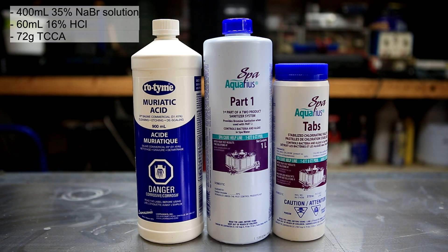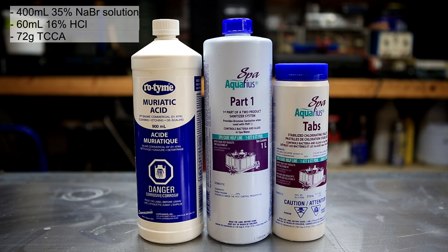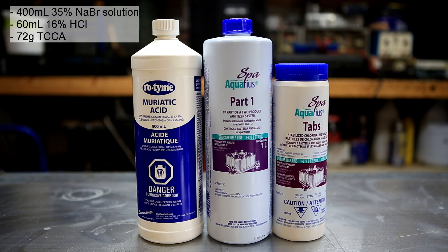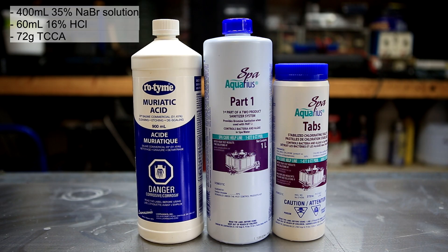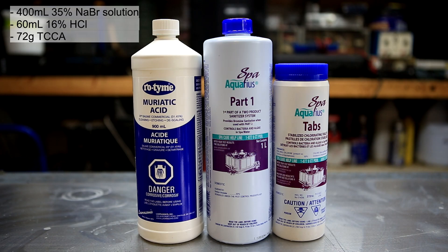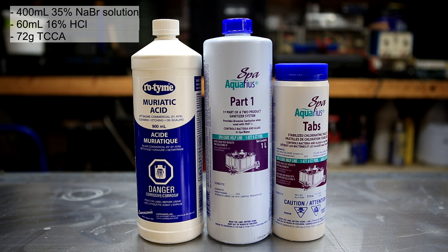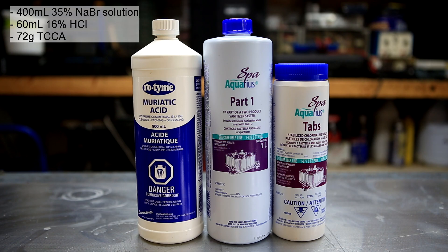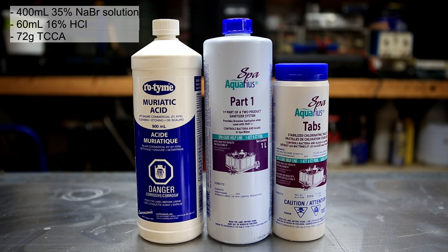In Canada, only the sodium bromide solution is sold and it's very hard to get the powdered form. The TCCA and hydrochloric acid will be used to produce chlorine gas, and the sodium bromide salt is our source of bromine. In short, the chlorine will displace the bromide ion to produce sodium chloride and bromine. Interestingly, the amount of muriatic acid used is three times less than what you would need stoichiometrically. I found it was possible to use less HCl, which decreases the possibility of contaminating the final bromine with HCl. On the other hand, a stoichiometric amount of TCCA and sodium bromide is used.